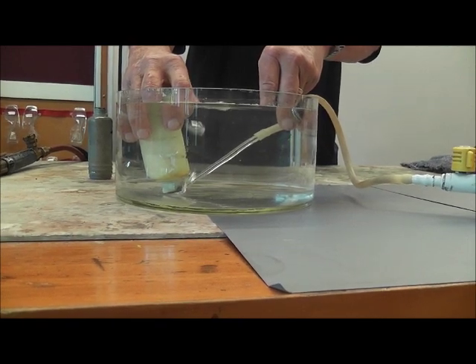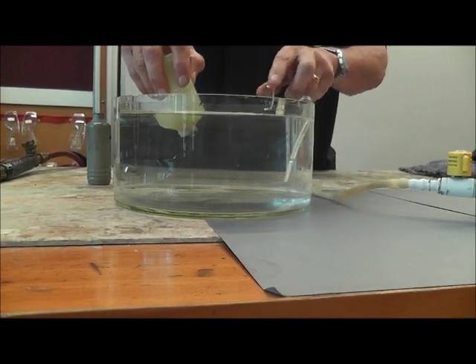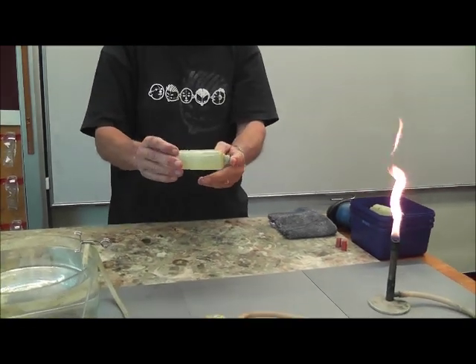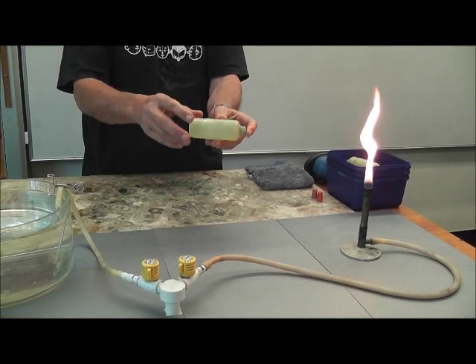And there we should be just about there now. It looks like it. So we'll take that out and we have a container full of propane, nothing else because we had water in there. The water is now gone.